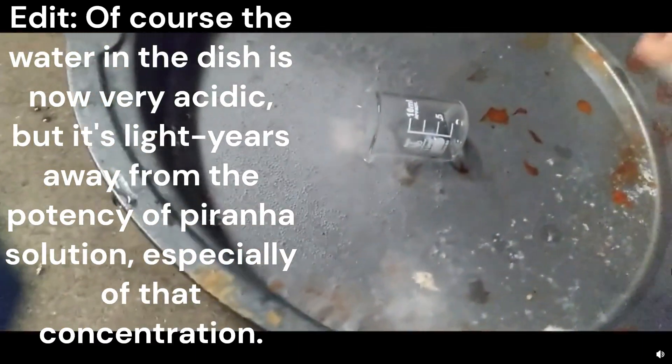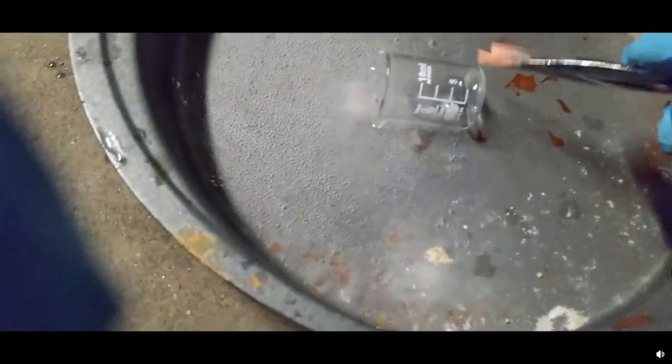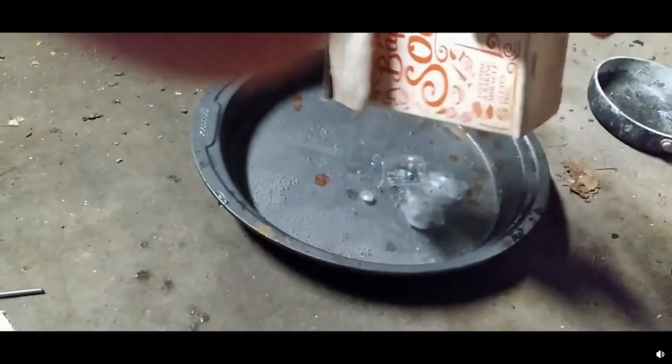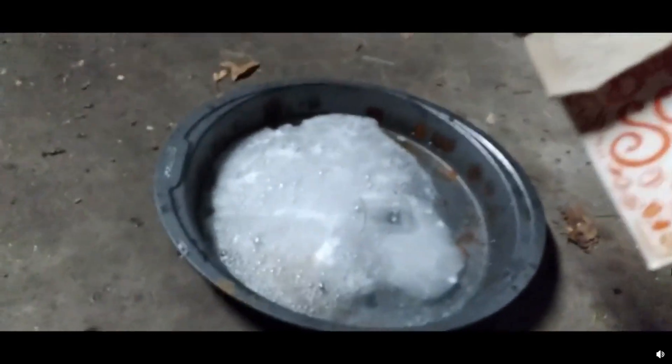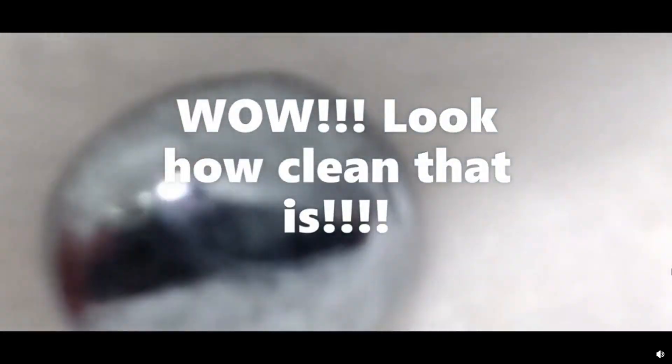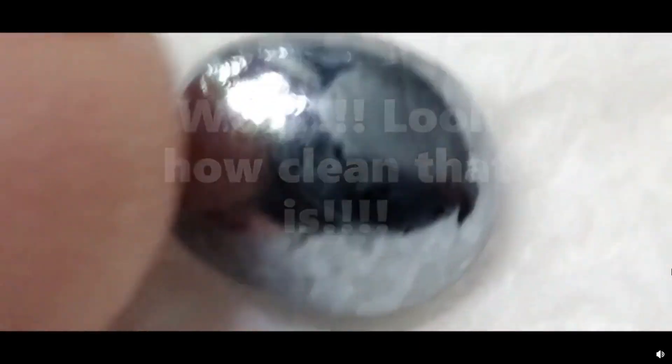Now we just gotta take our tweezers, which are now completely destroyed. I'm going to move this around a bit. You guys are not going to believe this. Unless my mind is playing tricks on me.